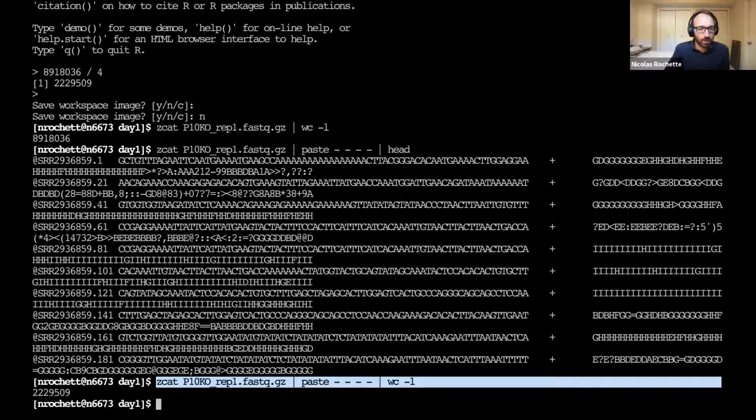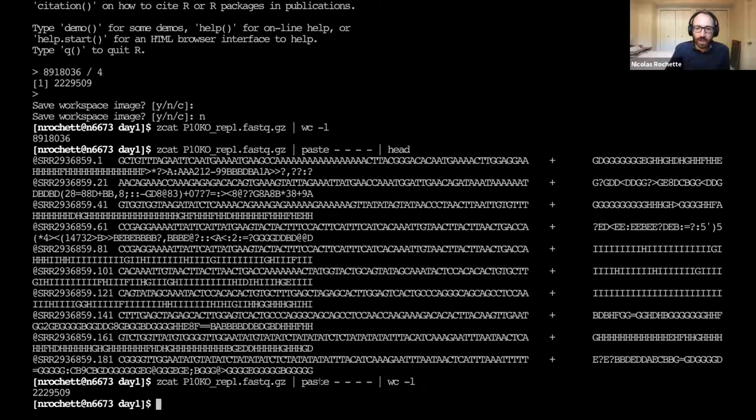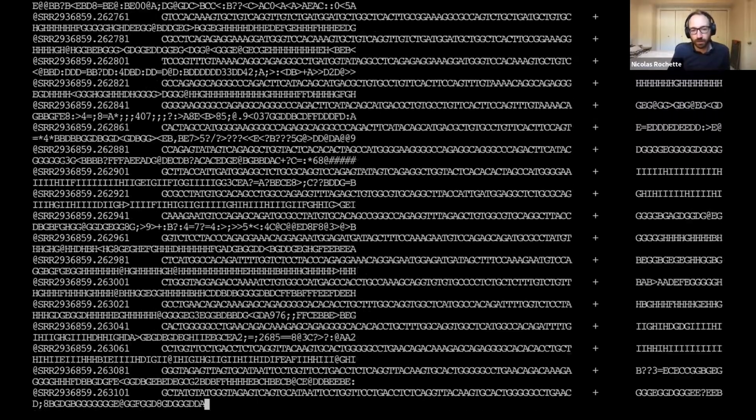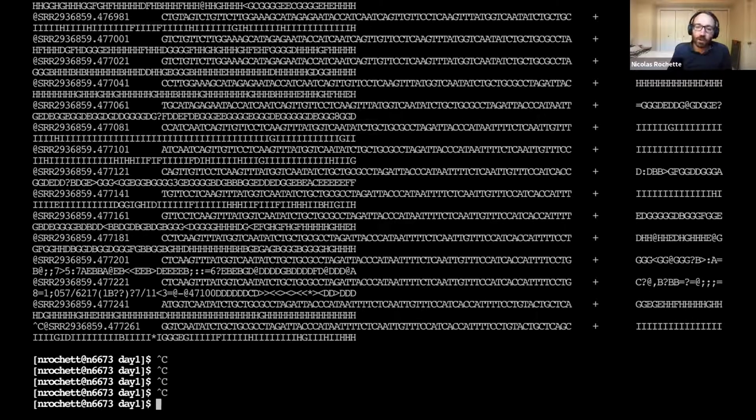Yes, that one. So this is counting the lines in the entire file. So I'm not using head here. I'm just getting the entire file. This is the 2 million reads, and it's kind of stuck now. Another thing is, when you have something like this that isn't going to finish, you can use Control-C to interrupt a command that's running.